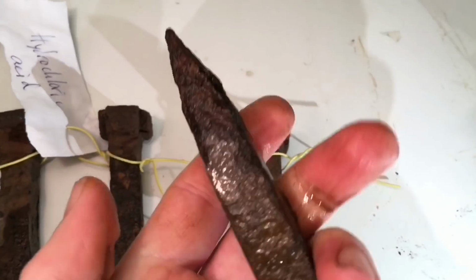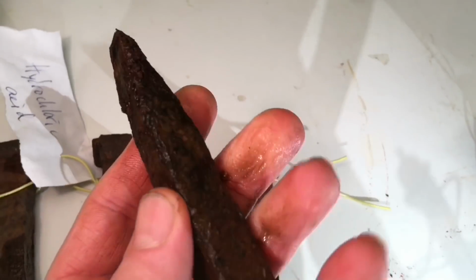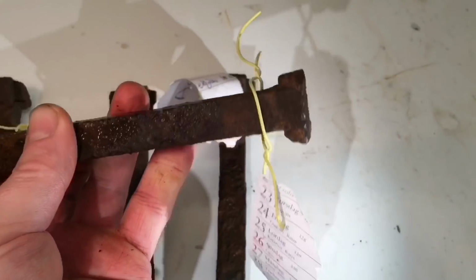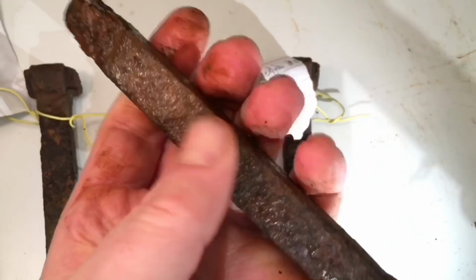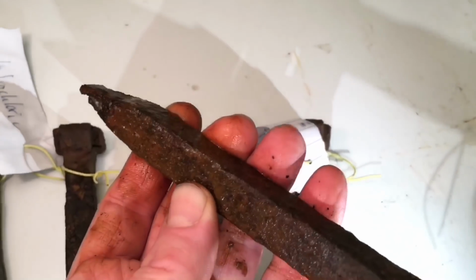Now we move to the acetic acid one. Here it's actually limited how much is coming off. It doesn't come off so much on my fingers. This has been the worst performer, definitely. Acetic acid, although 6 times as strong as in white vinegar. Finally, here is the nitric one. Nitric acid. Well, you see, some of it's coming off on my fingers. But it's not all the way down to the iron.